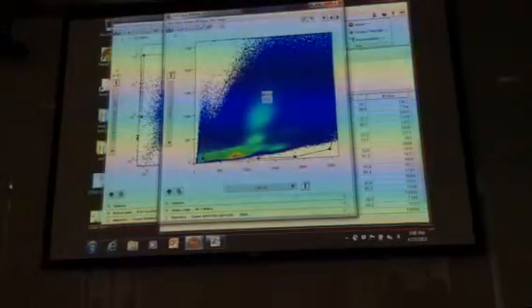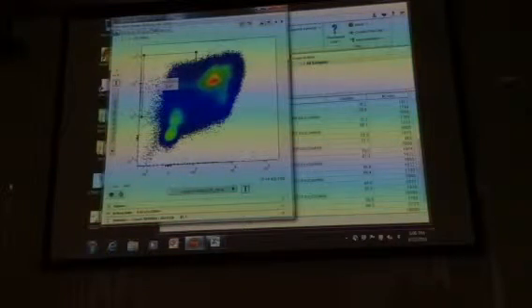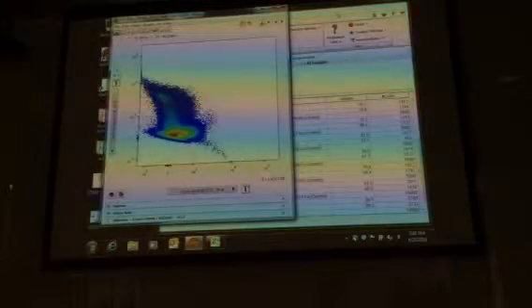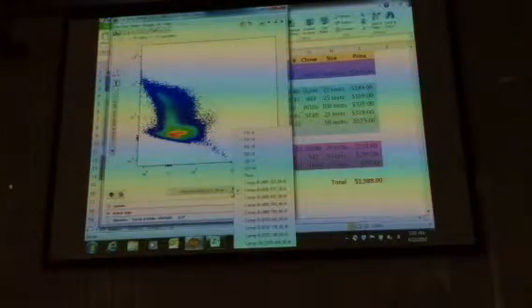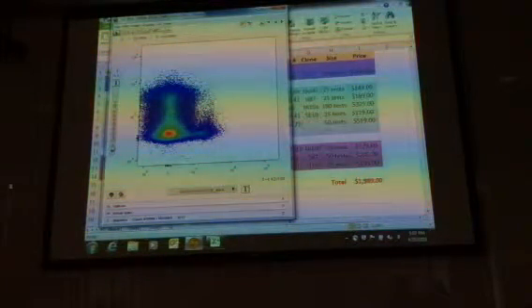Okay, so we went from our mononuclear cells. From this, we then went to our Lin negative CD45 cells. These are Lin negative CD45 positive cells. If we double click on this, then what we want to do is look at CD34 and CD38. The CD34 is Alexa Fluor 700, so it's a 633 laser, 730/45 filter set. Then we also have CD38, which is the PerCP eFluor 710 here. The eFluor 710 is 488, 695/40.